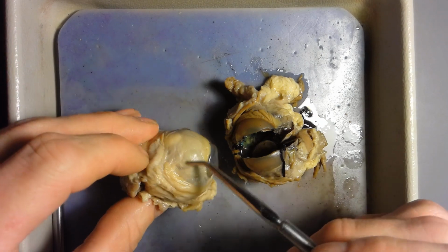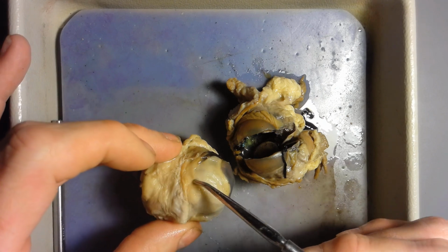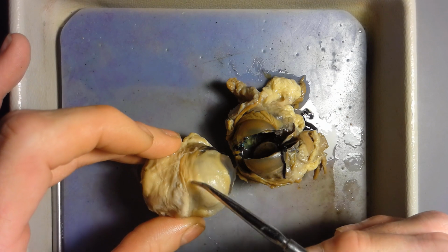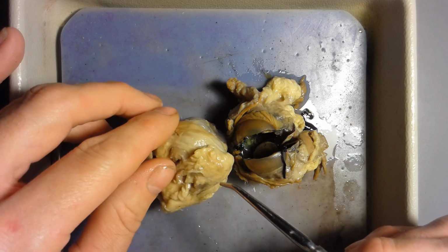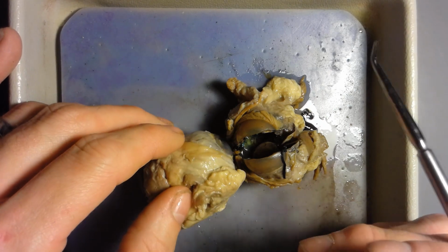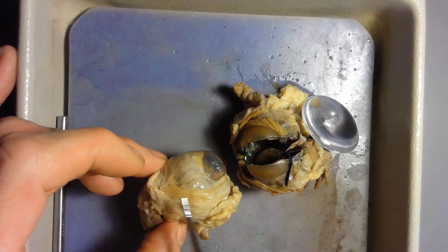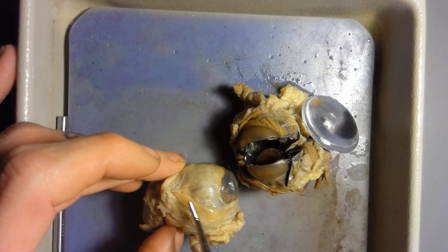Okay, if I'm rotating this eye around, you're going to see some features that are the muscles, and these are what's called the extrinsic eye muscles, the muscles on the outside of the eye. They're kind of brownish in color, all over the place here. You can see them really well on the model. But on here, you've got to look for a little bit of a yellowish band, yellowish brown bands that you see stretching out in all different directions.